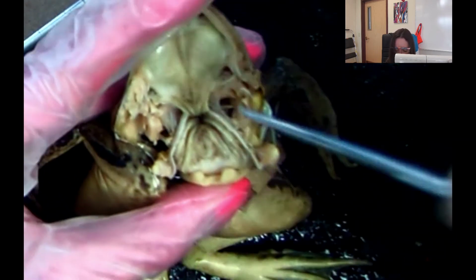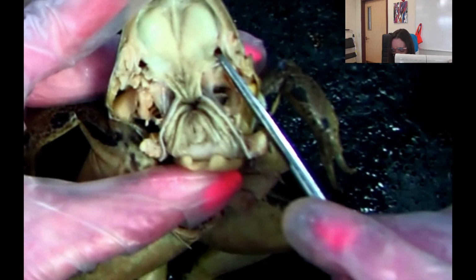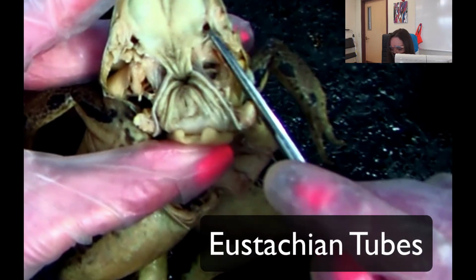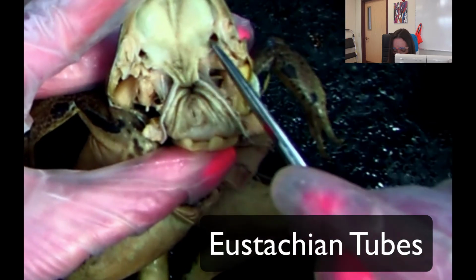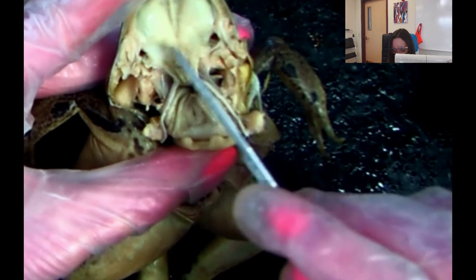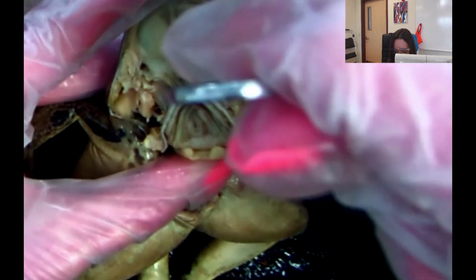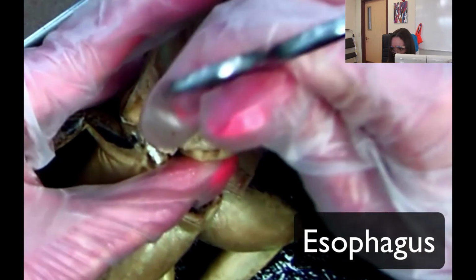And then another thing actually that I want to show you that's really easy to see are these two holes right here. So these two holes are called the Eustachian tubes. So the Eustachian tubes help with the frog's ear pressure. That's what Eustachian tubes are. We have Eustachian tubes as well. So that helps with the frog's ear pressure. Okay? And then also, we're just going to do this for the quiz. Down here is the esophagus. So down here is the esophagus. Okay? So let's go ahead and review.